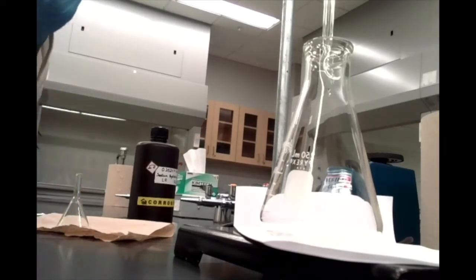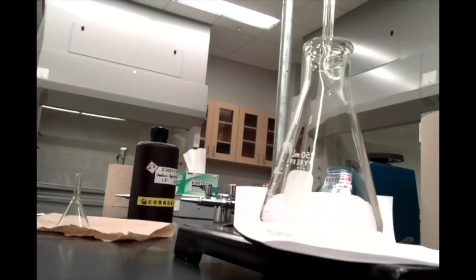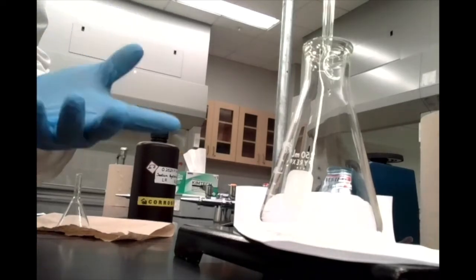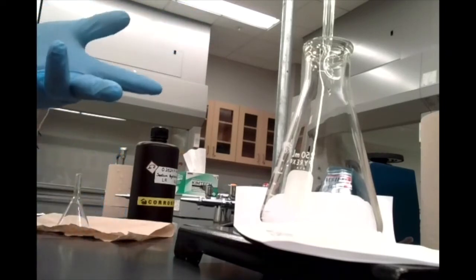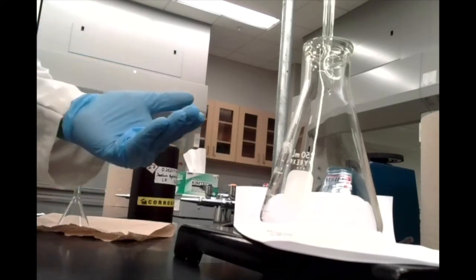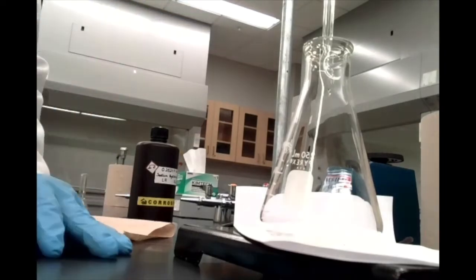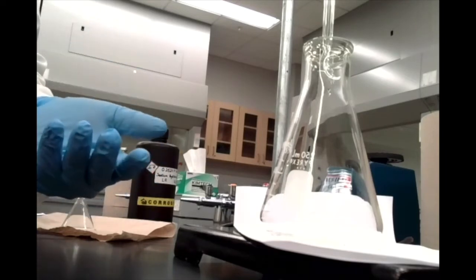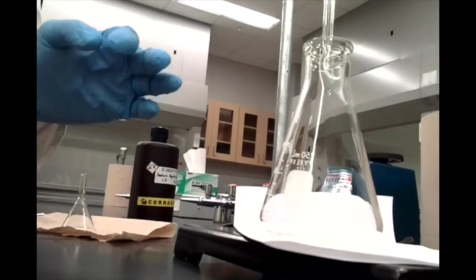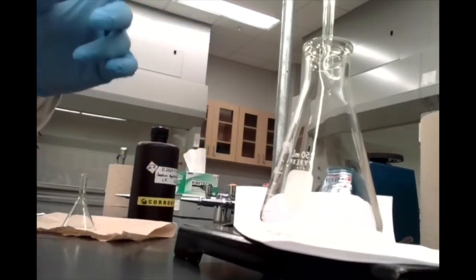Okay, now I mentioned earlier that because that first trial is a little rough, its purpose is not so much to give us a right answer, but to tell us where to aim our next couple of trials. All right, so you saw that I added roughly about 18 milliliters. So I'm going to add about 16 milliliters or so, and I can add that really quickly without really paying attention. And at that point, I'm going to start being very careful about how much sodium hydroxide I add. Okay, so let's keep that in mind for this trial.